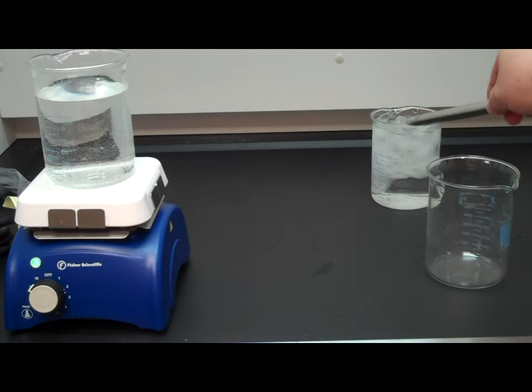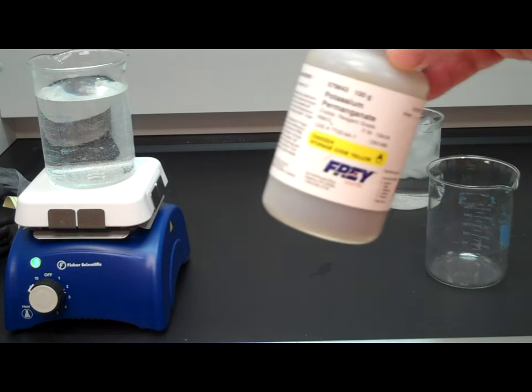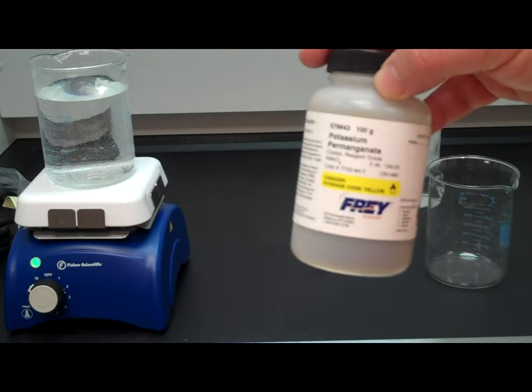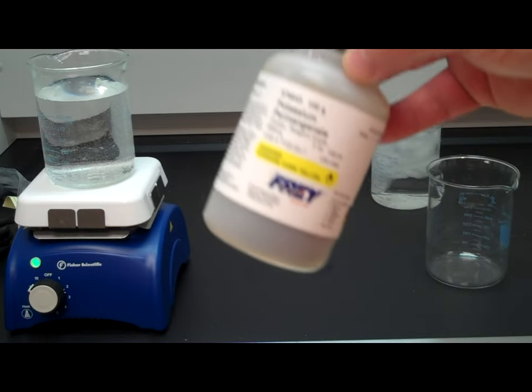I have some ice water back here that we're going to use. I'm also going to use potassium permanganate, but any dye could work just the same. I like this because it's purple.